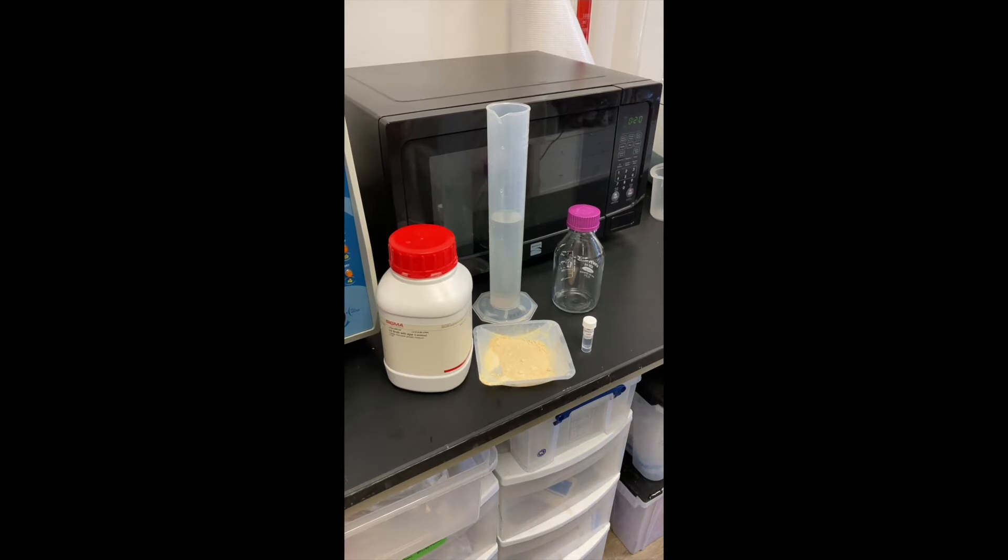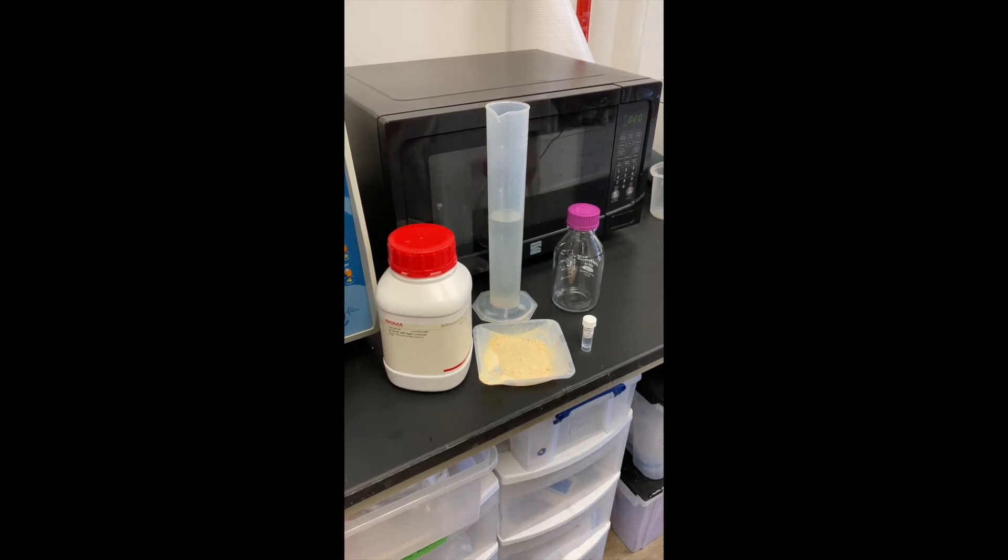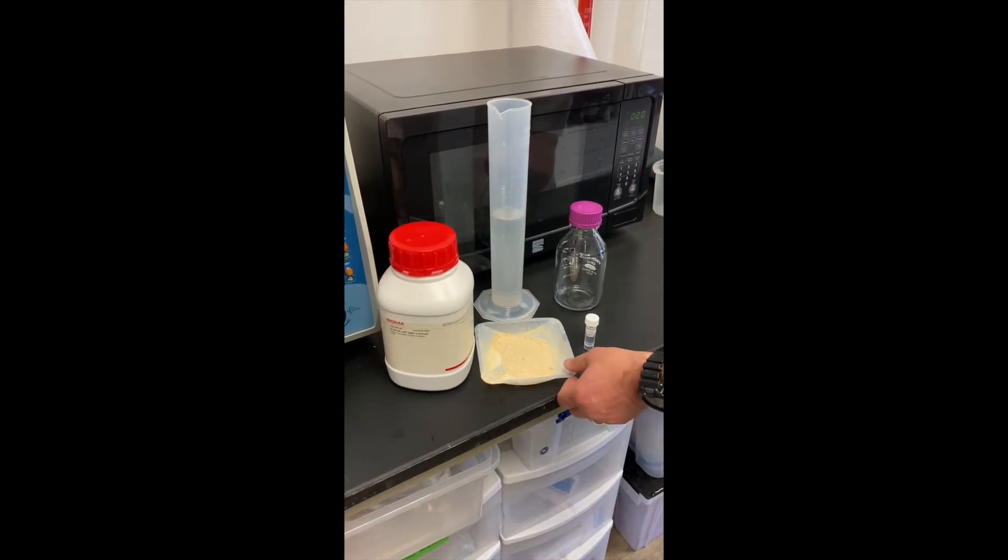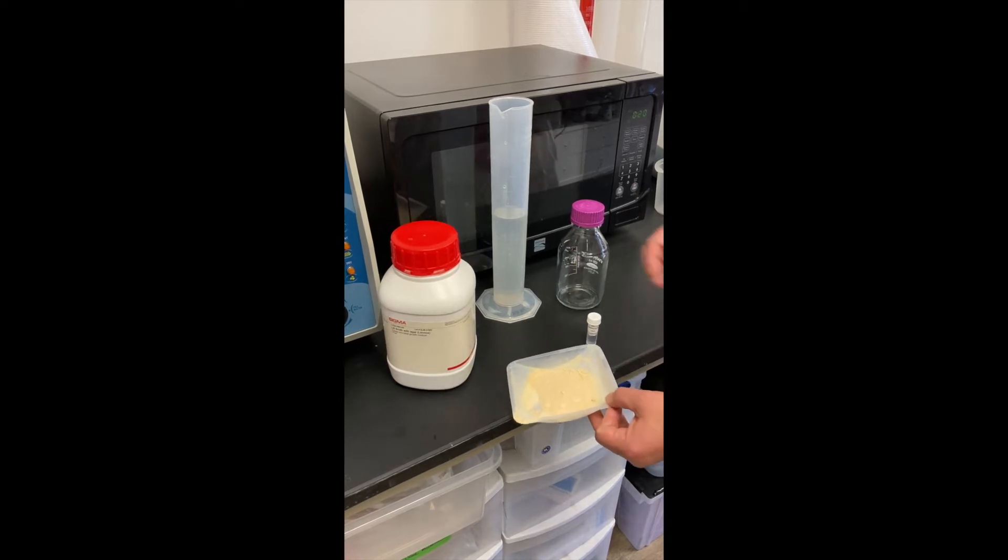In this video, we'll demonstrate how to make LB agar plates with ampicillin to grow antibiotic resistant bacteria in the lab.